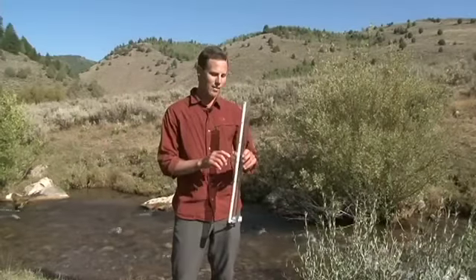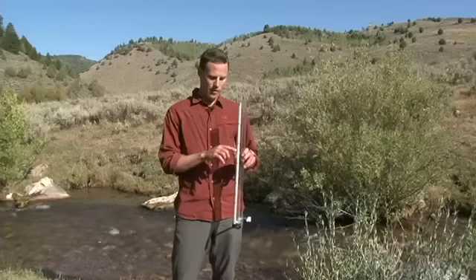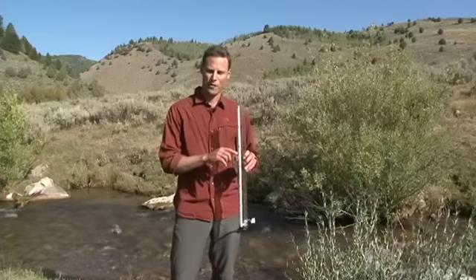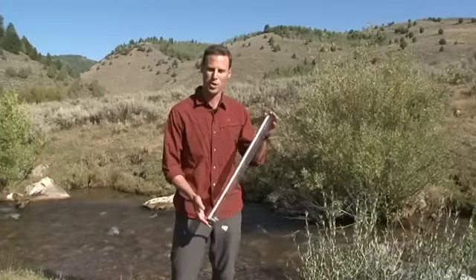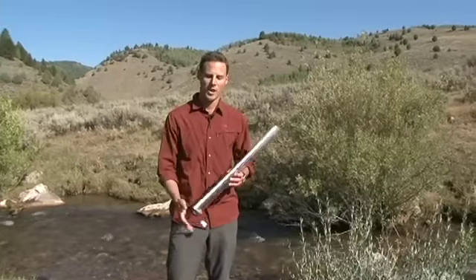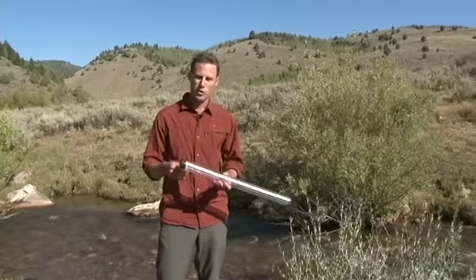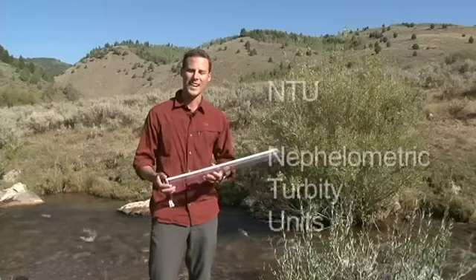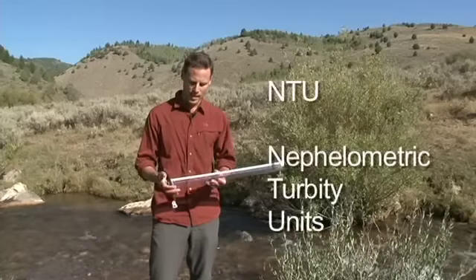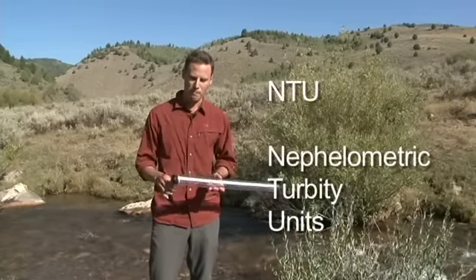Once you have a measurement of the turbidity level using your turbidity tube, you can then, on your chart, convert that to the units that we use to monitor turbidity. They're called NTUs, which is the unit of measurement.